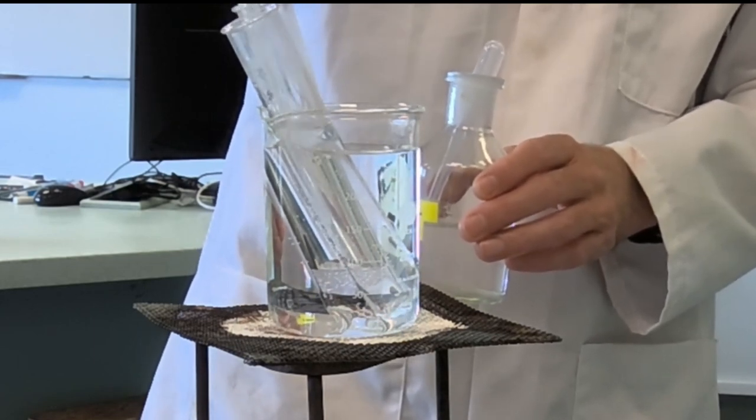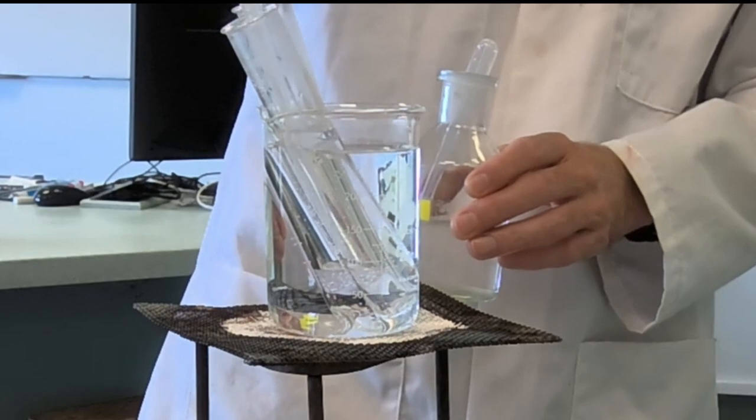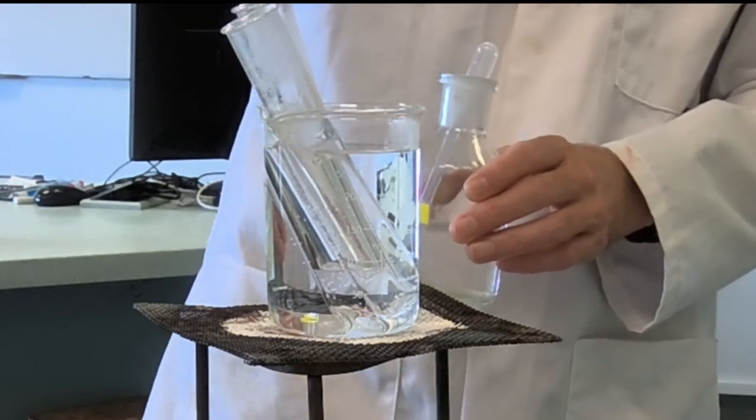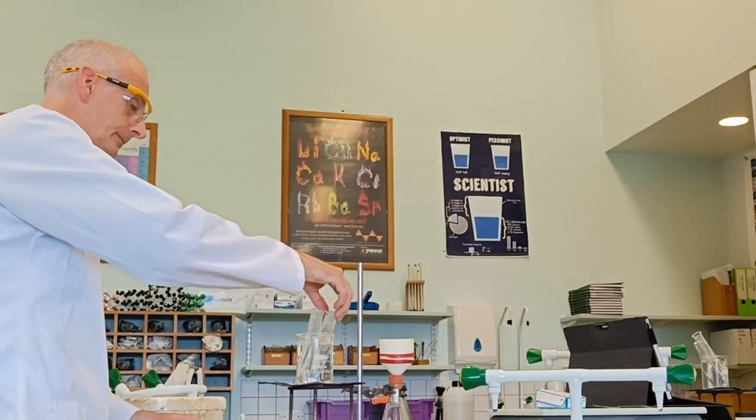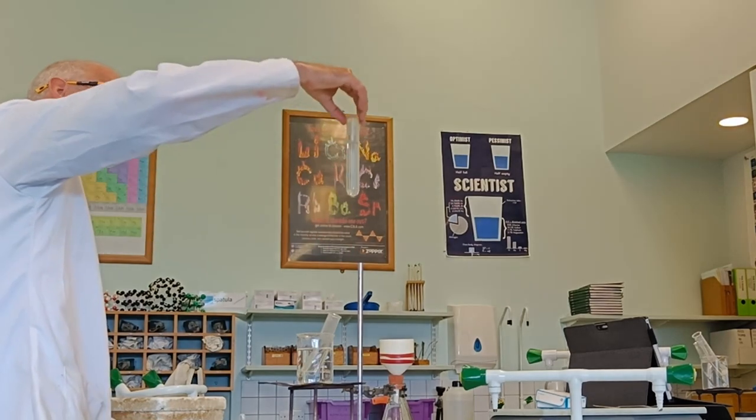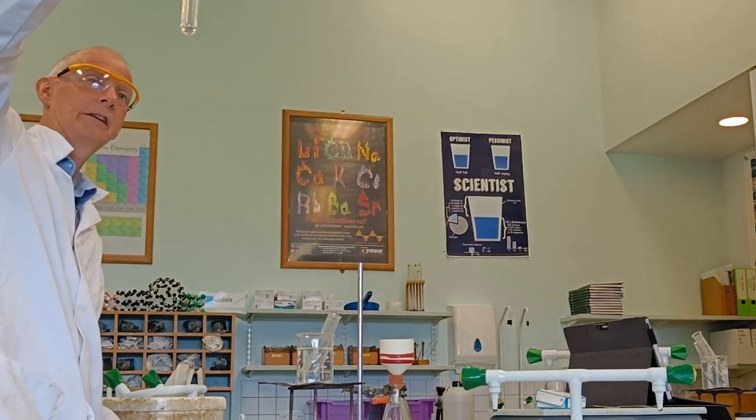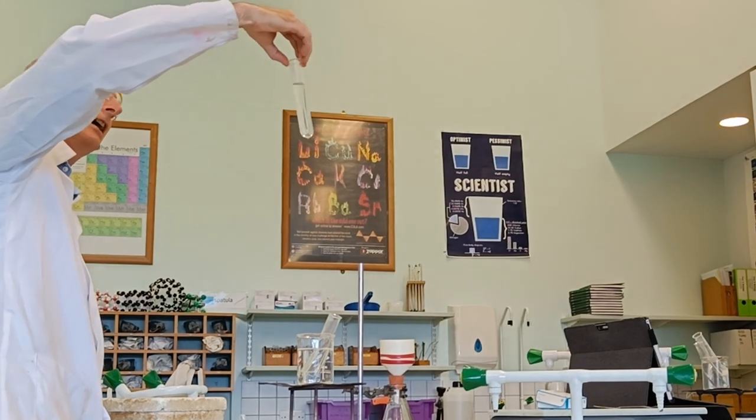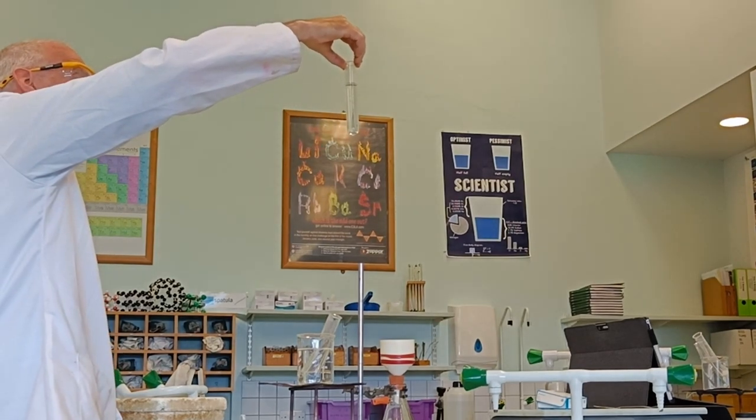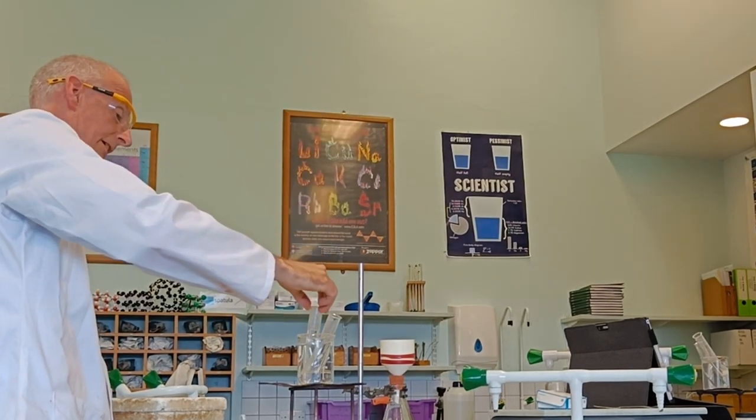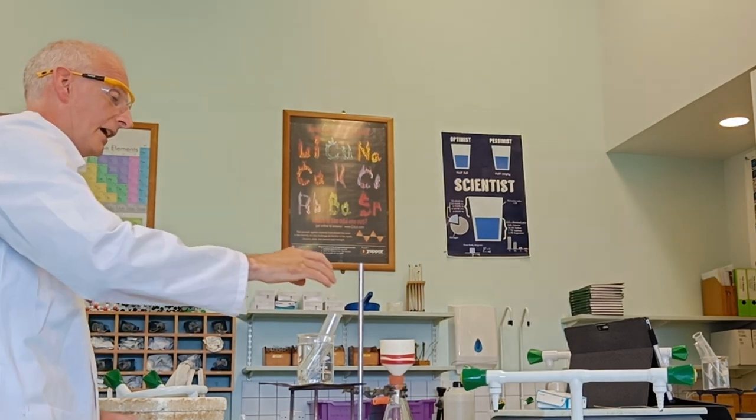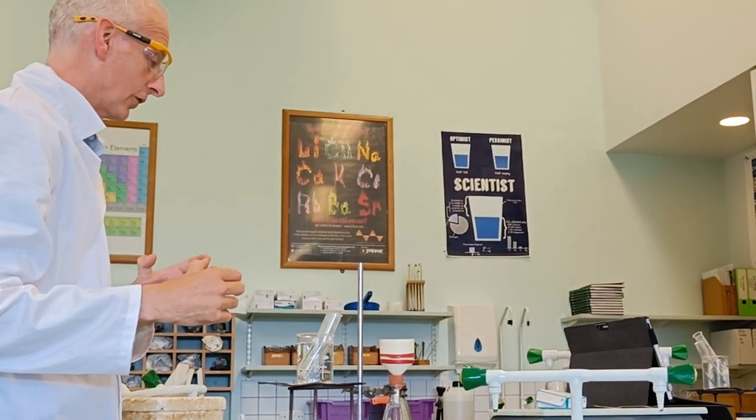I've got one little chunk there. I'm reluctant to add more ethanol. Remember, I just want to get that point where it just dissolves. Lift it out so you can see. Can I see through it? Yeah, I think that's gone. Just gone.